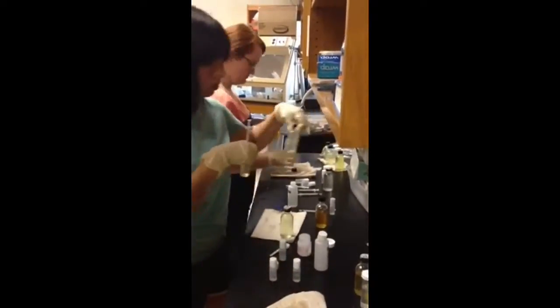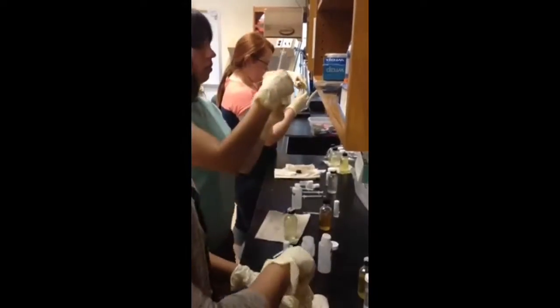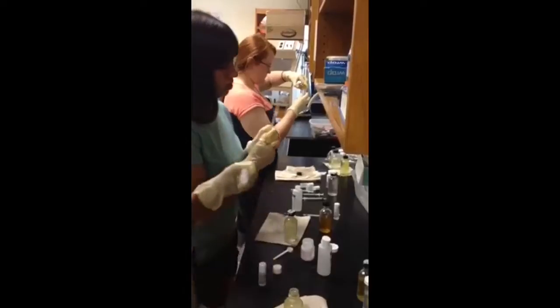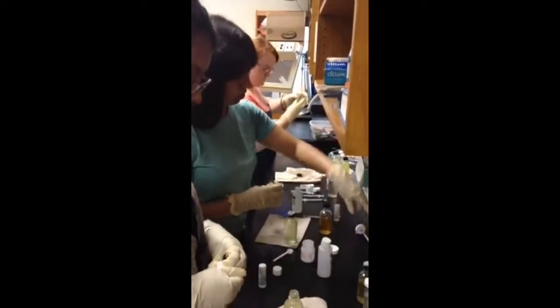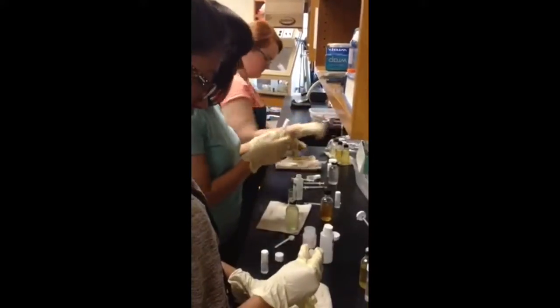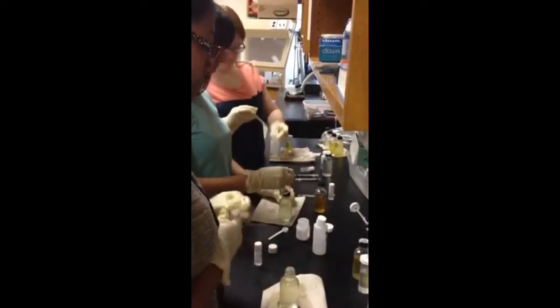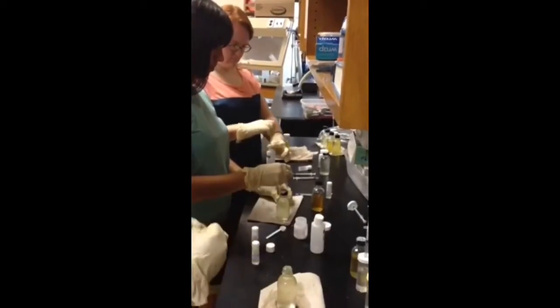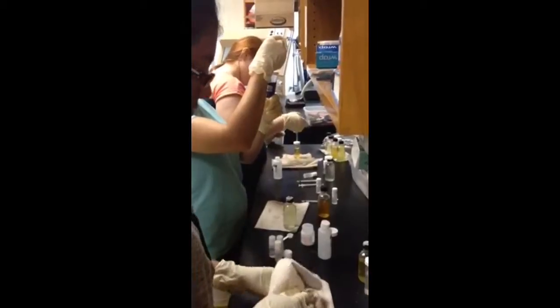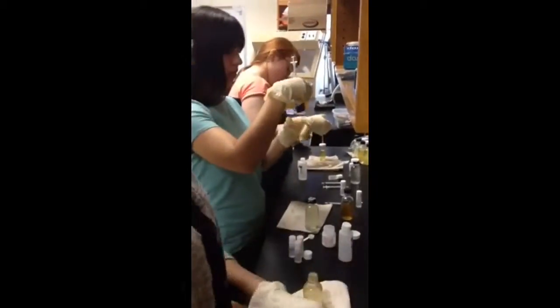We have 5 different concentrations. We have 0 molar, 0.001 molar, 0.01 molar, 0.05 molar, and 0.1 molar. And in titrating, gross and net productivity. So Elena, can you explain how the titration process works?